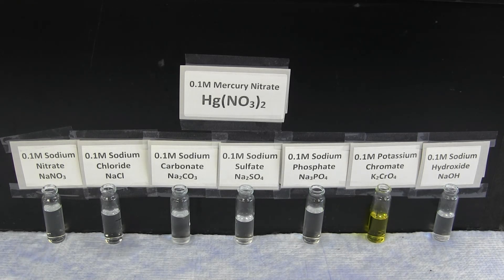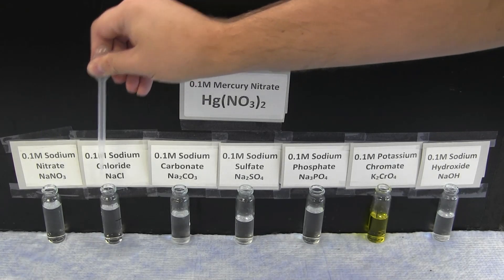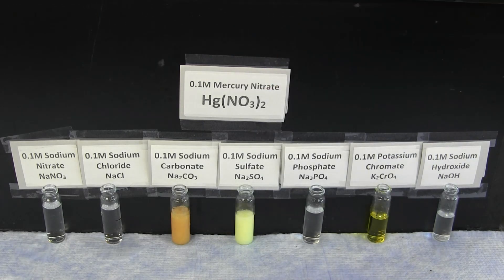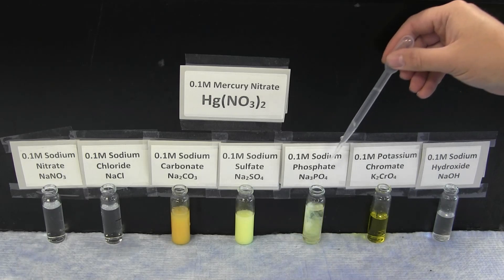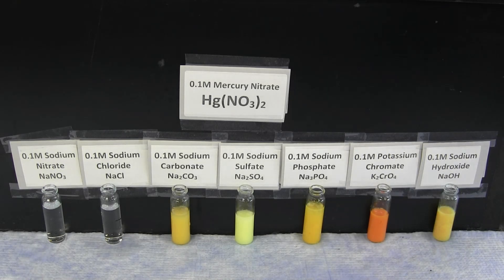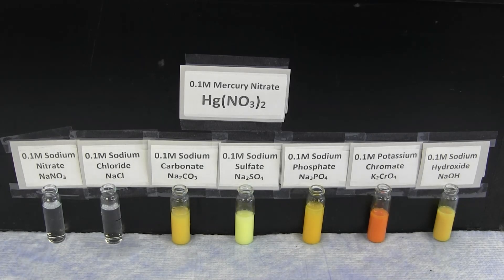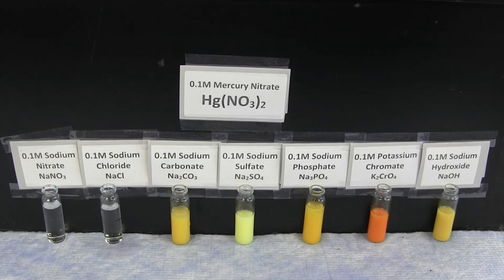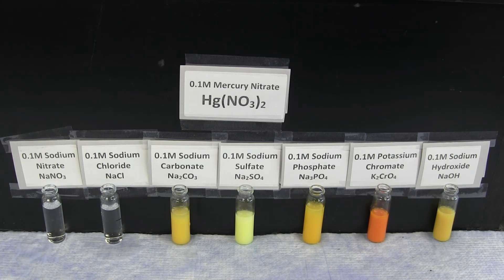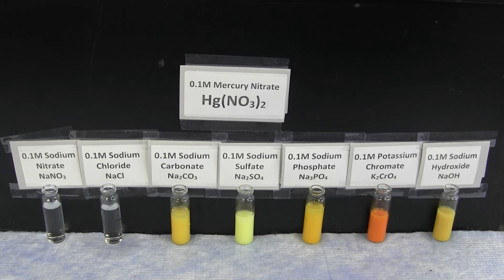The next ion to observe is the mercury ion. The mercury ion forms an orange precipitate with sodium carbonate, sodium phosphate, and sodium hydroxide, a yellow precipitate with sodium sulfate, and a red precipitate with potassium chromate. There is no reaction with sodium nitrate or sodium chloride.